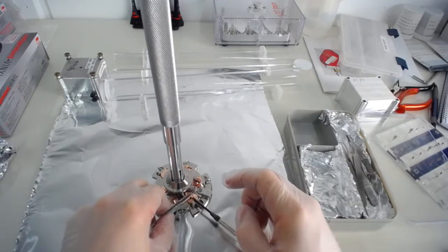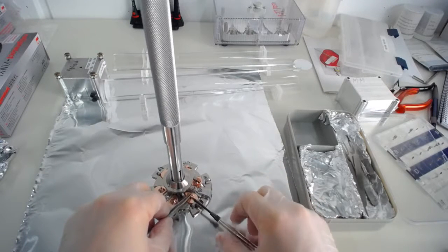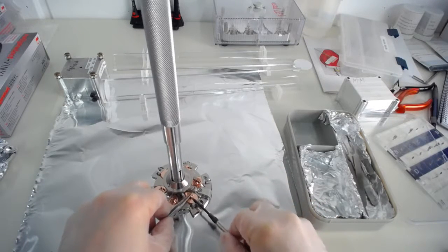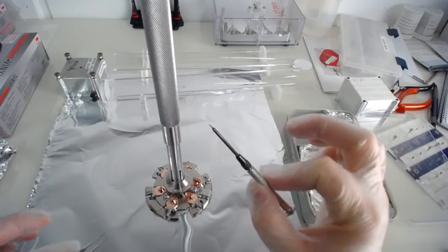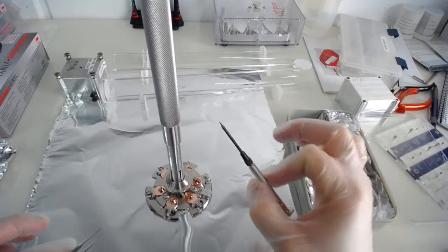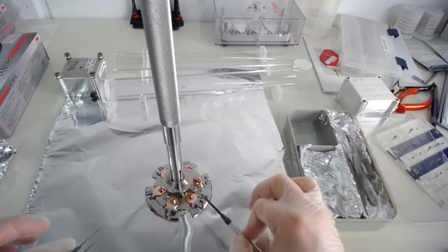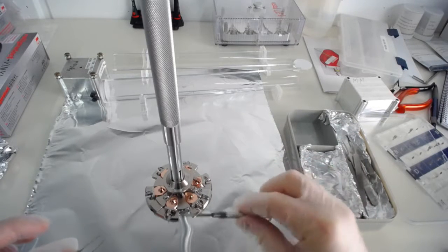And of course if you take your, you put your new sample in, whole thing in reverse and just tighten it with your index finger and your thumb. If you need any more force than that, then it's too much force.